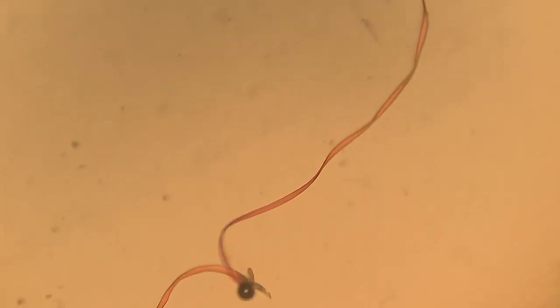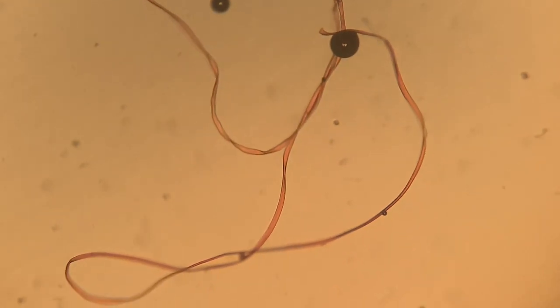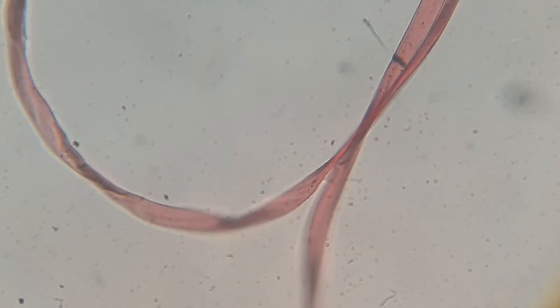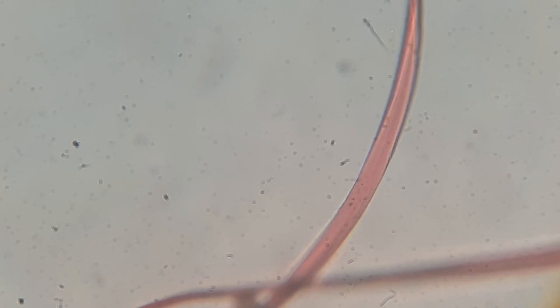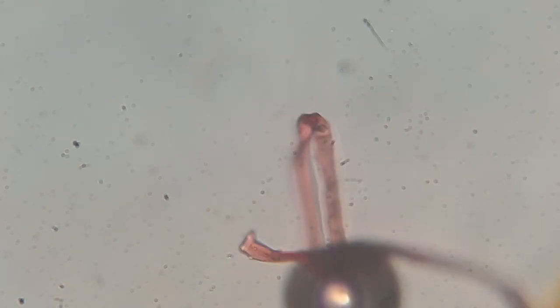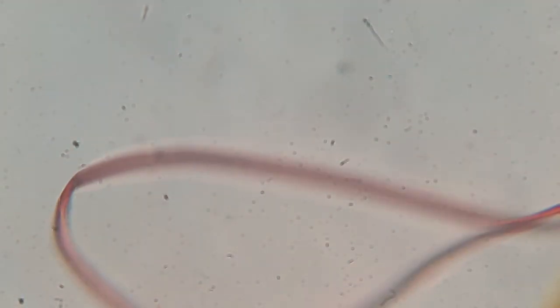But I was surprised at how much I found in this single drop. If you look at the research, we do, as humans, consume a significant amount of microplastics every single year. There are a ton of articles online where you can find estimates as to how much microplastics we consume every year, as well as some articles suggesting what these impacts may be on the human body — what they do to cells and what they do as they accumulate in our intestines or in our lungs. Because these can be found in things like bottled water or even the air we breathe. Microplastics are kind of everywhere.